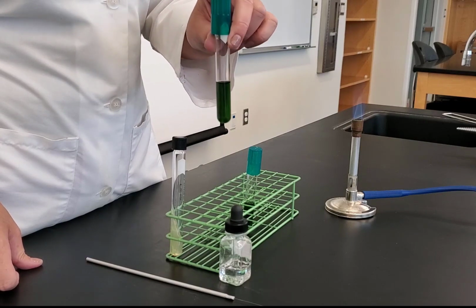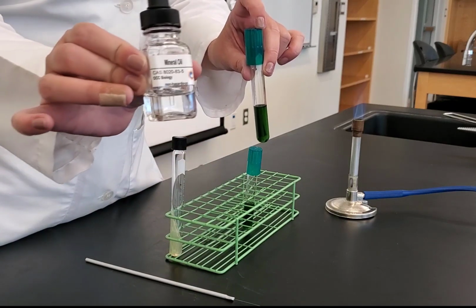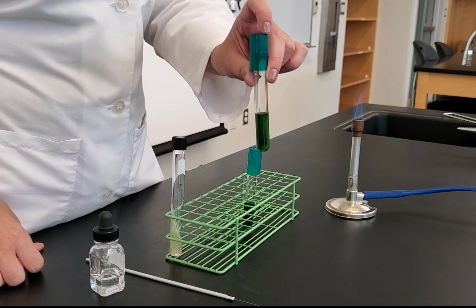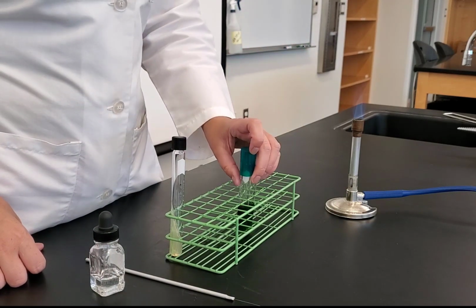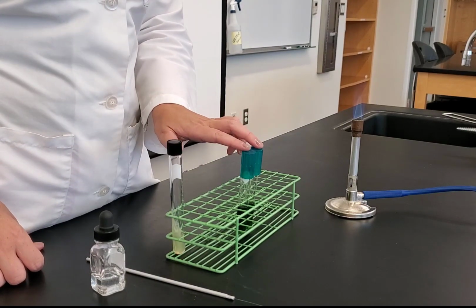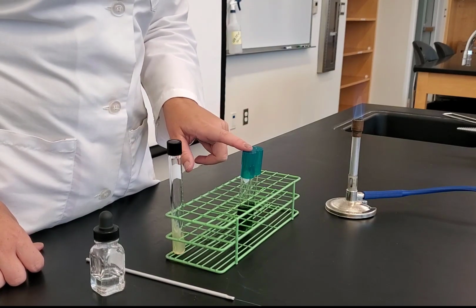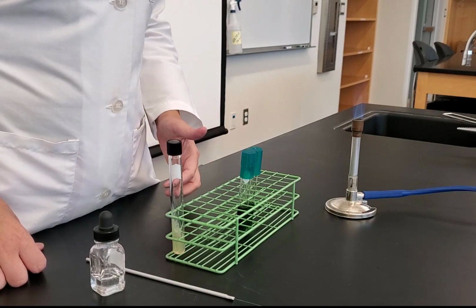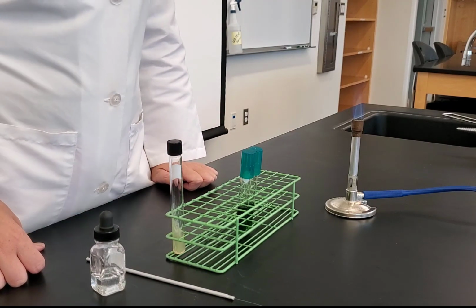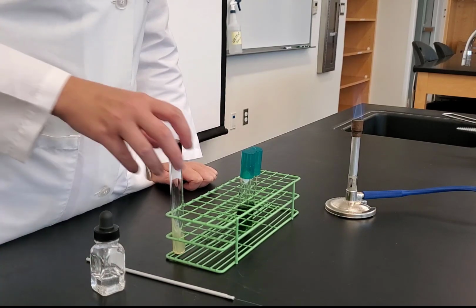The way that we're going to make this tube anaerobic is after we inoculate the bacteria, we're going to put a layer of mineral oil across the top, and that's going to seal out the oxygen so that tube is anaerobic. So what we need to do is take our organism and inoculate it into 2 tubes, because 1 tube is going to be aerobic, 1 tube is going to be anaerobic. In this experiment, we actually will be doing this with 3 organisms, but for the sake of demonstration, I'm just going to demonstrate with 1 tube, 1 organism.